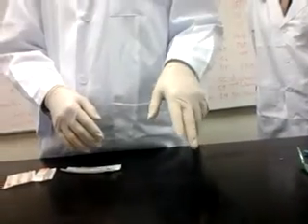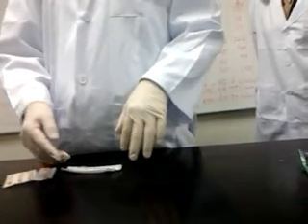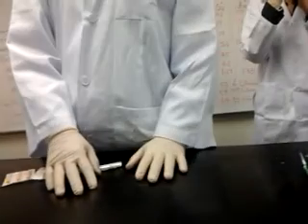I'm going to use a backhand to do IP, and to do subcutaneous, to show you for mouse, so that you learn how to do subcutaneous when they are alive. So we're going to prepare the drugs, and we see how long it takes to sleep. This is a mixture of ketamine and xylazine.